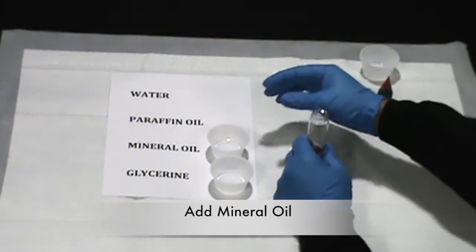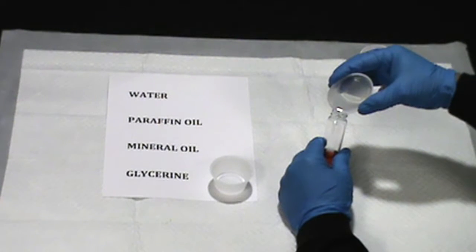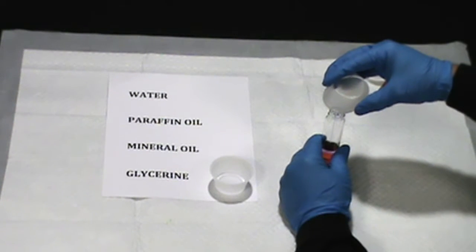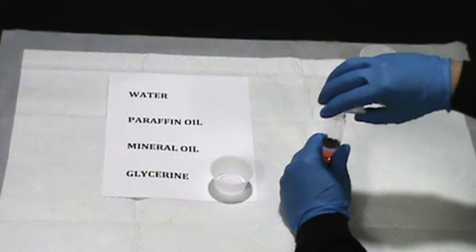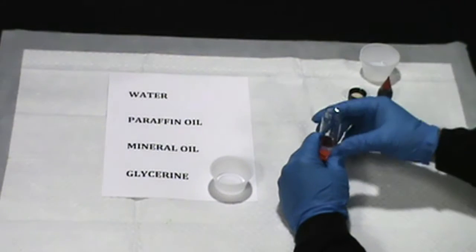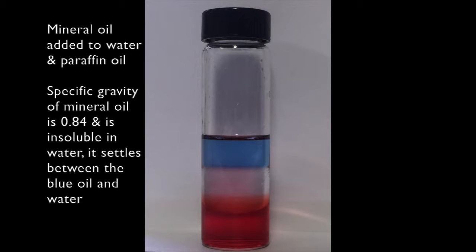Now we will add 10 milliliters of mineral oil to the glass vial that already has the water and the paraffin oil in it. The mineral oil we added is the clear layer above the red water and below the blue paraffin oil. As you can see, the mineral oil is not soluble with the water. The mineral oil specific gravity of 0.84 makes it lighter than the water, but still heavier than the blue oil.